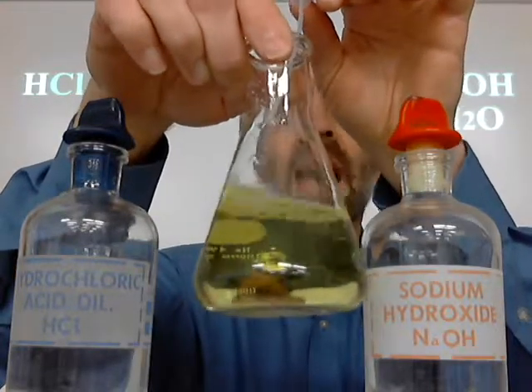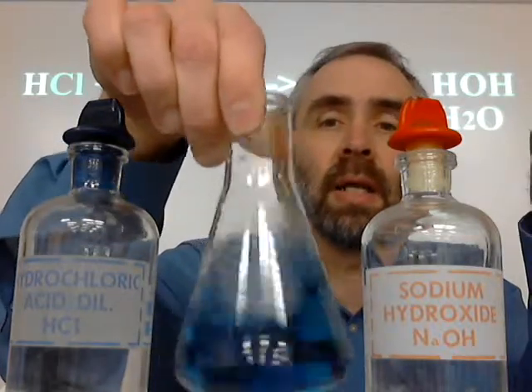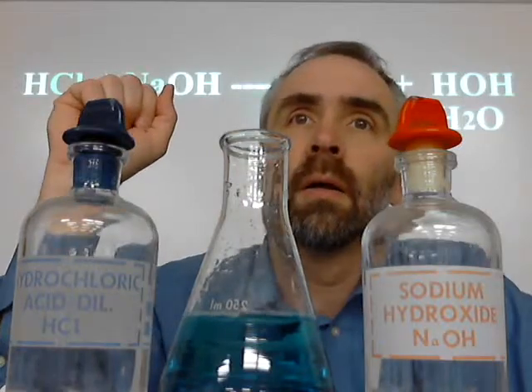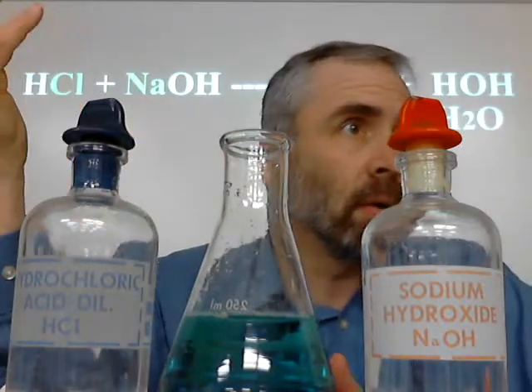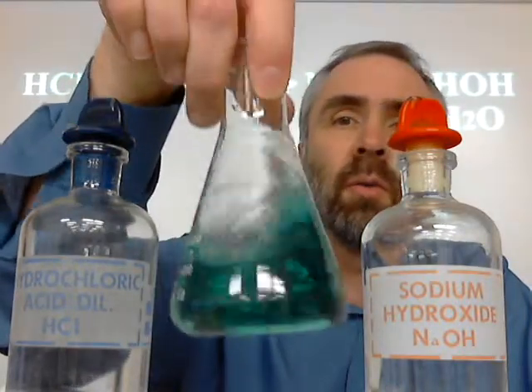Green. If I add this perfectly, and I get this to turn exactly green and back to neutral, what will I be dumping down the sink? Water and salt water, right. If that's basically almost back to where it was before, it's kind of the same color green it was.